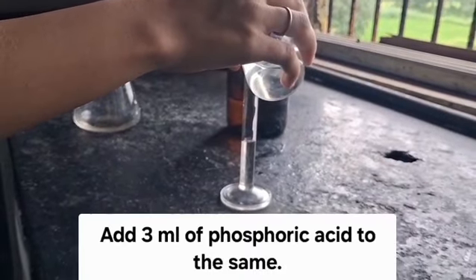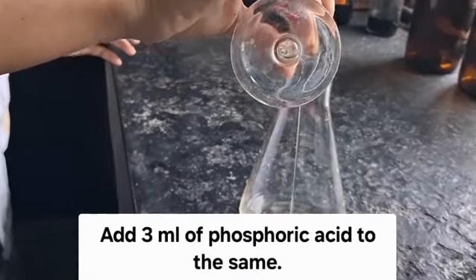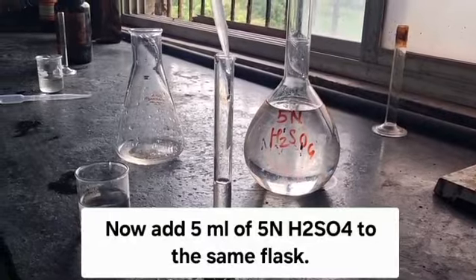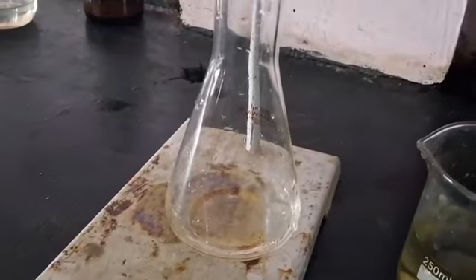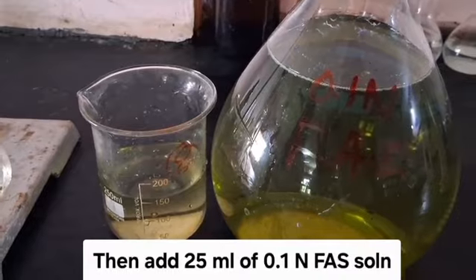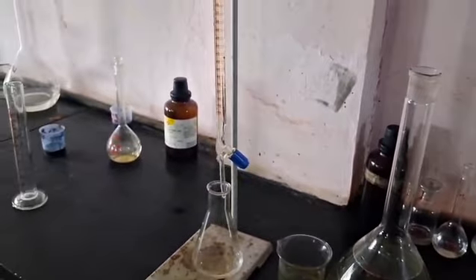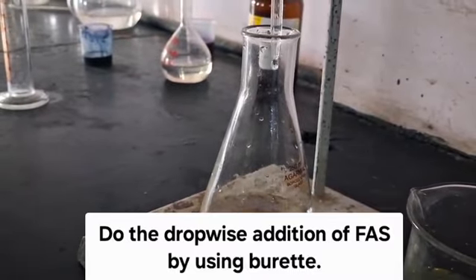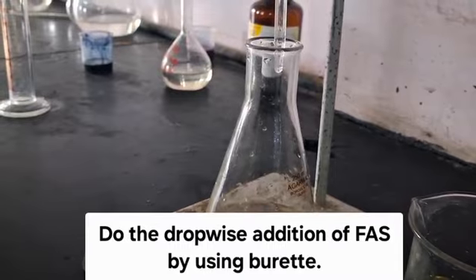Measure 3 ml of phosphoric acid. Add the same into the conical flask. Measure 5 ml of 5 normal H2SO4. Now to the same flask, add 0.1 normal ferrous alum solution with the help of a burette. Do the addition of ferrous alum solution drop by drop.